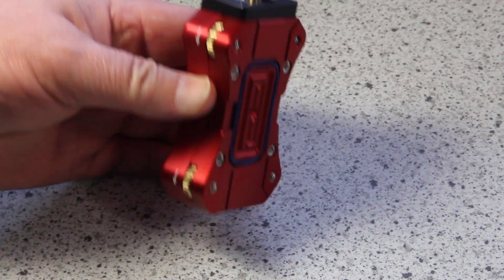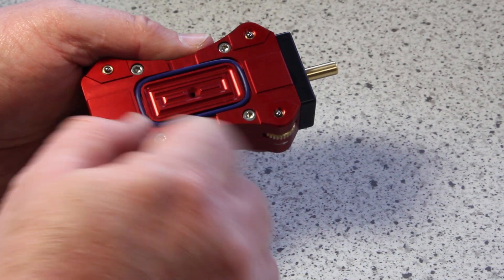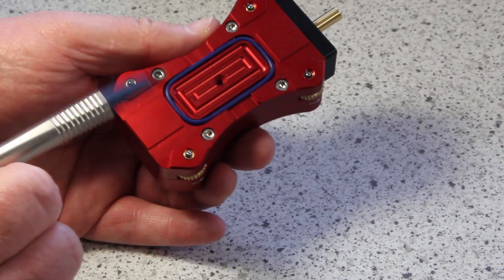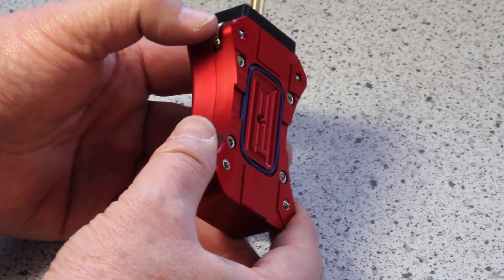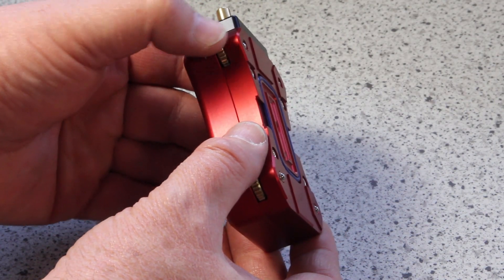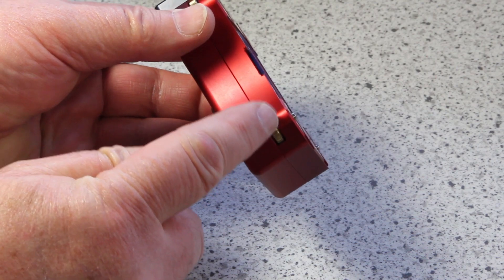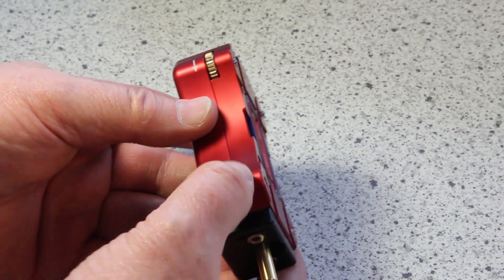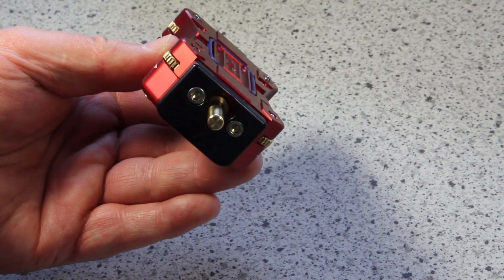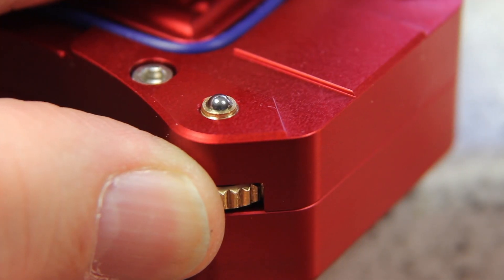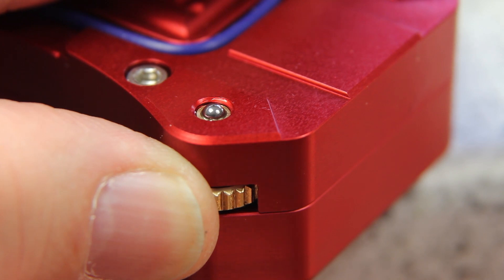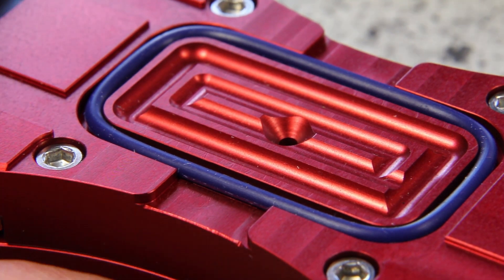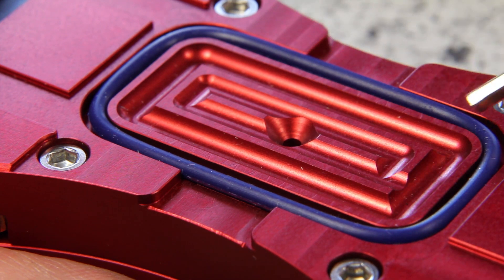Now I check the thin section mouse. It has to be clean. No foreign particle should be in here or in some other place on the bottom side. The counter nuts must be easy to move, all four. It's important. Turn back all four feet completely.